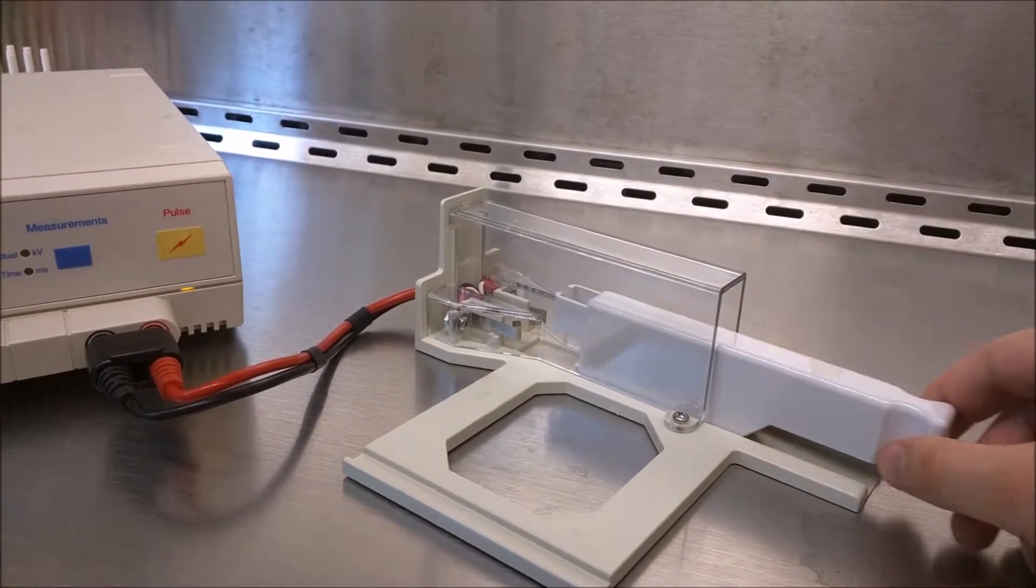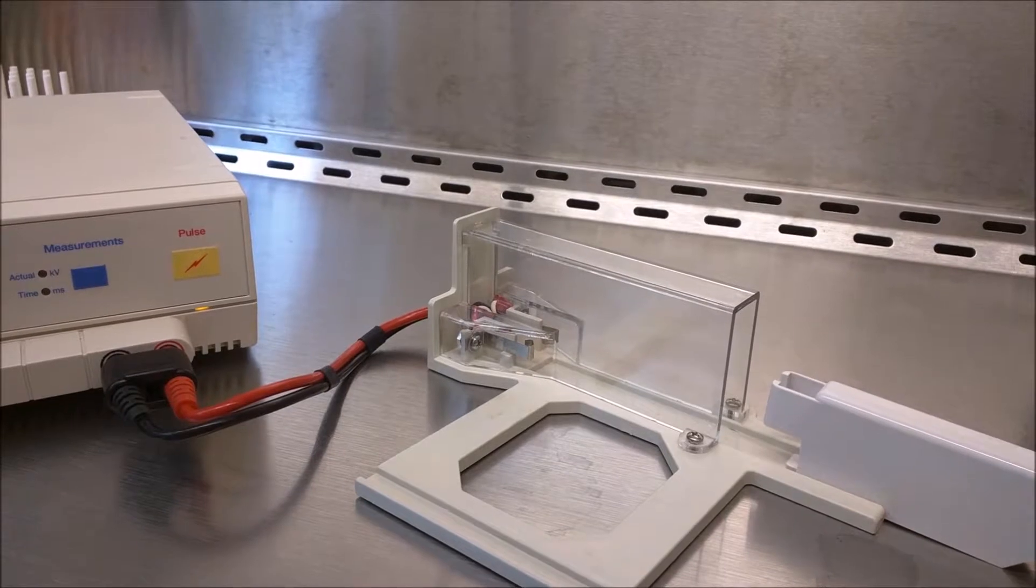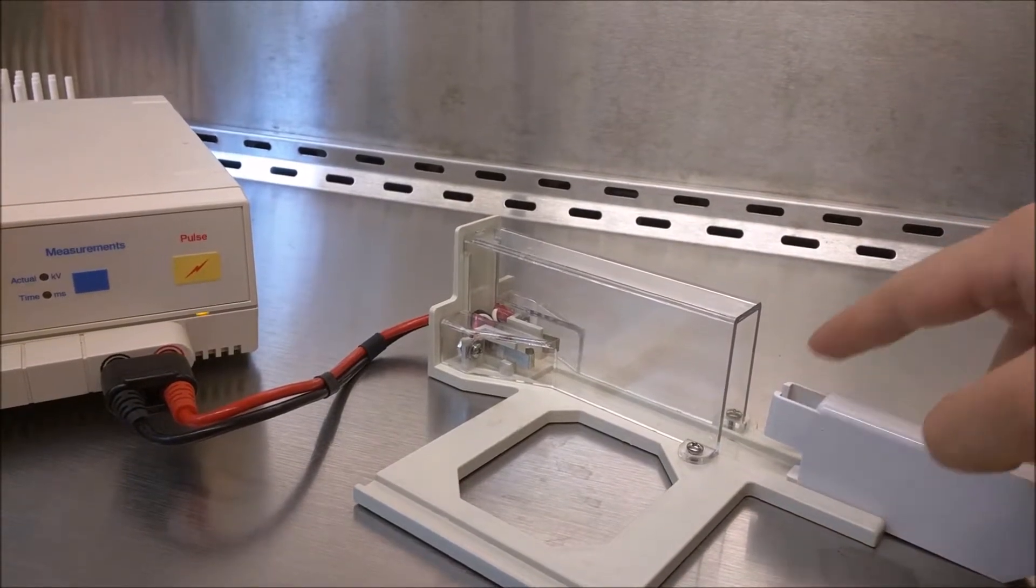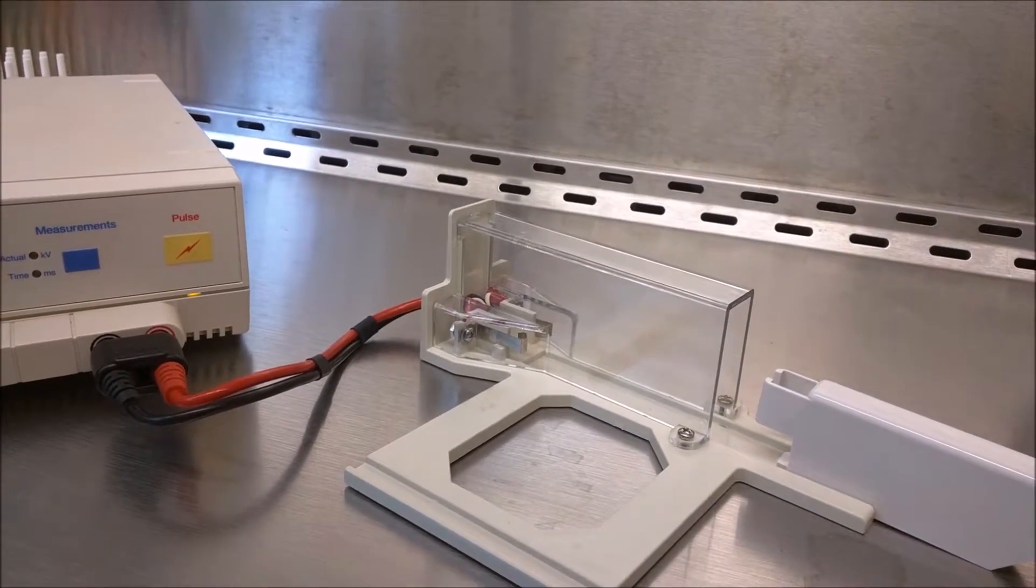A cuvette with Agrobacterium and our plasmid goes here, and then we can hit pulse.